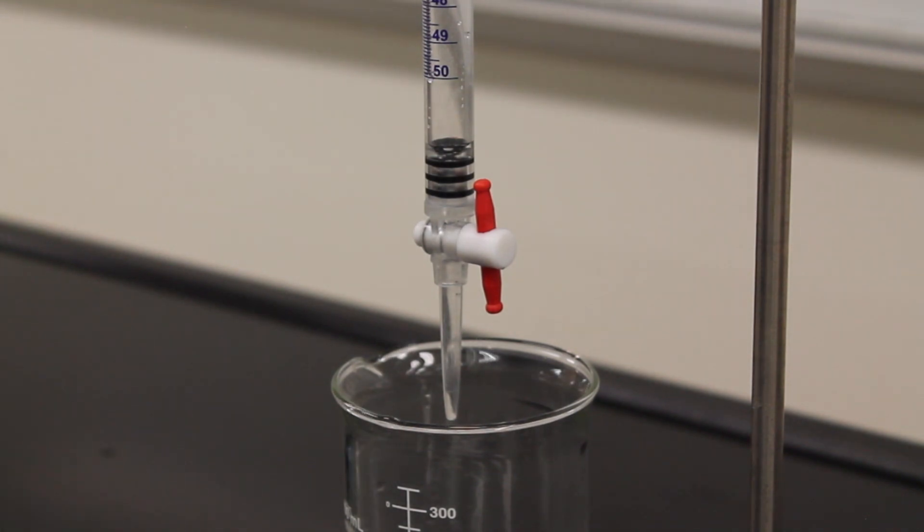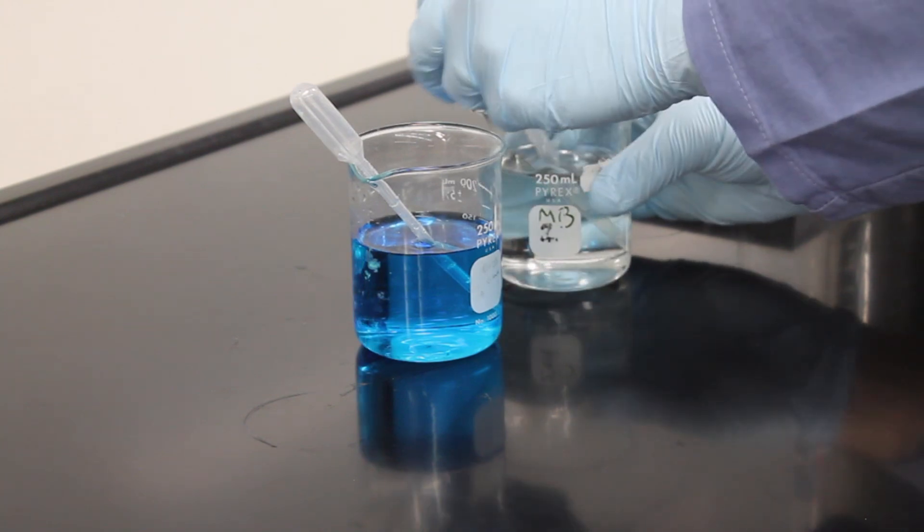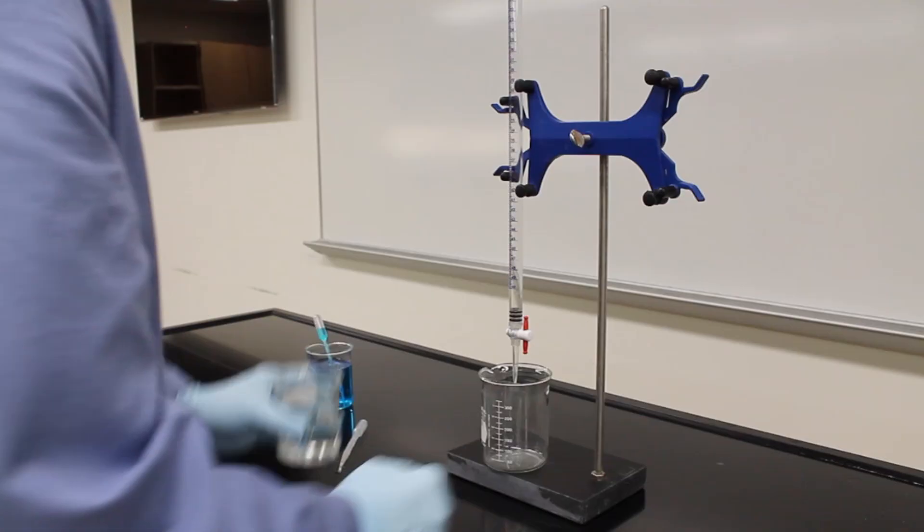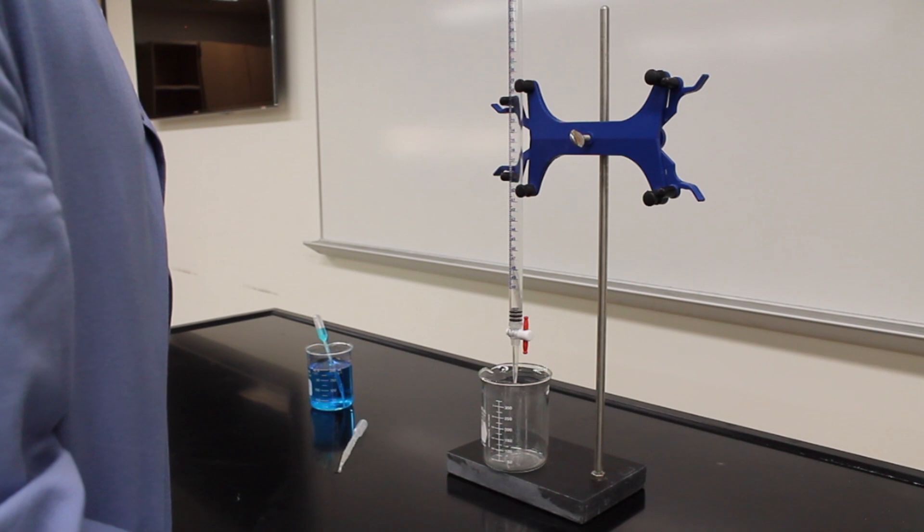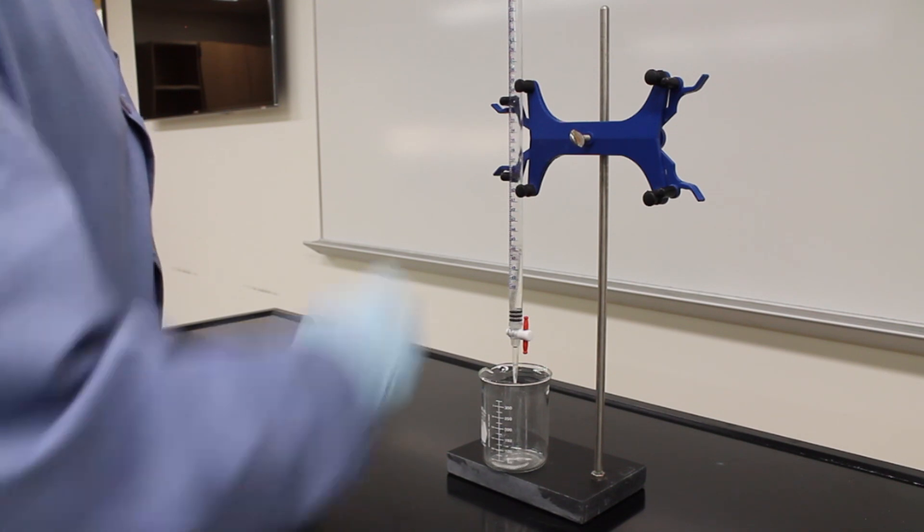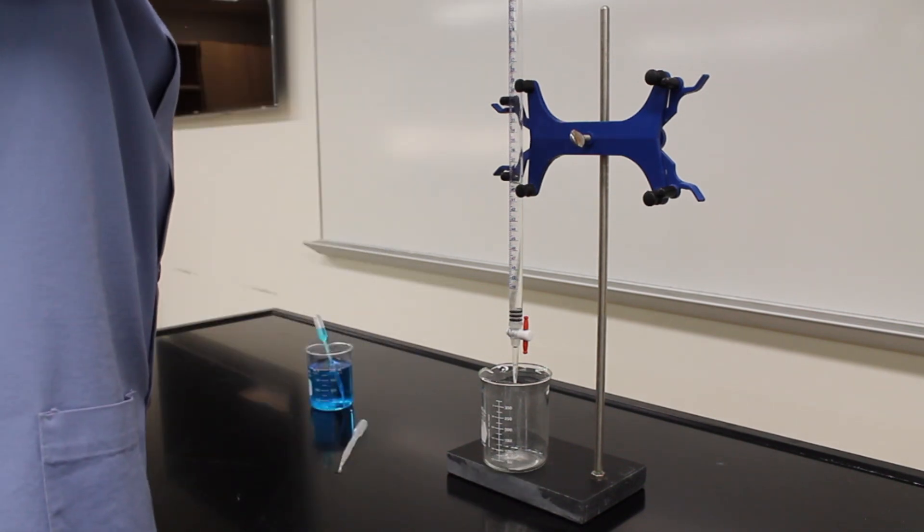Start cleaning your burette by taking your deionized water and partially filling the burette. Let the water run all the way out of the burette.